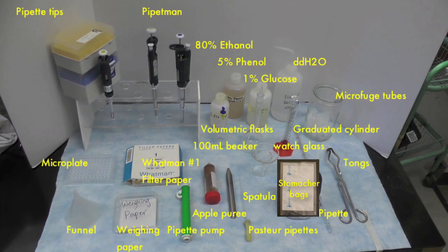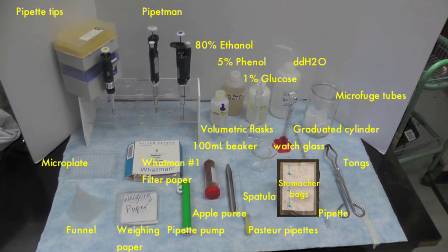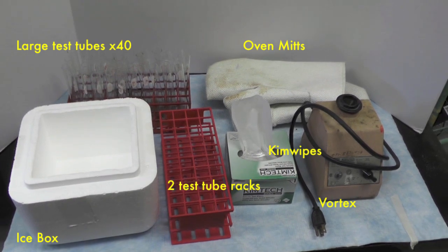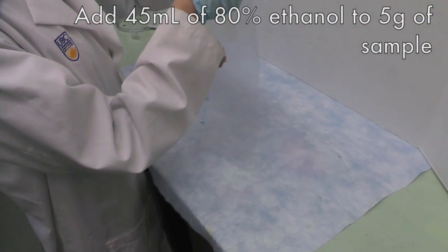This video will demonstrate how to perform carbohydrates analysis using the phenol-sulfuric acid method. Here is the equipment you will need. First, prepare the sample using ethanol extraction.